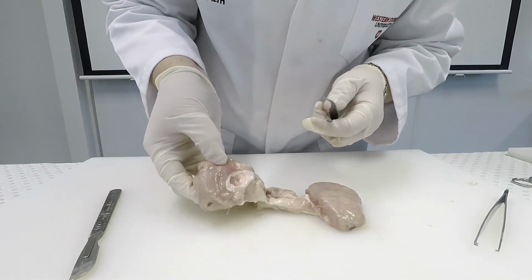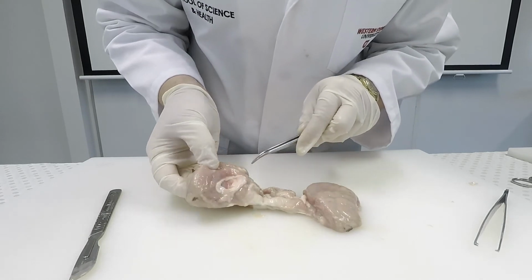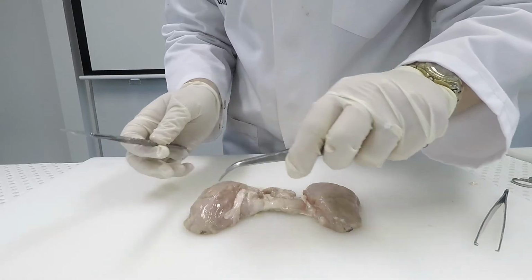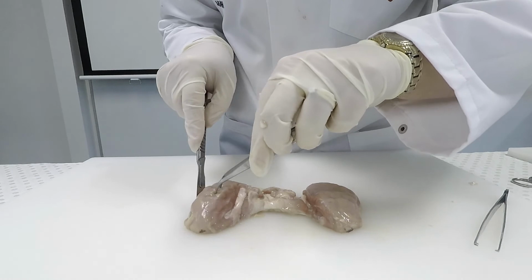and that's a structure found in eutherian mammals that allows communication between the left and right hemispheres. In the middle you can see it's slightly a grey section. That's one of the ventricles.